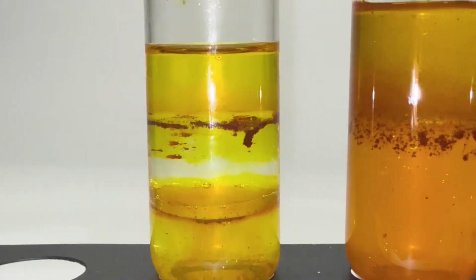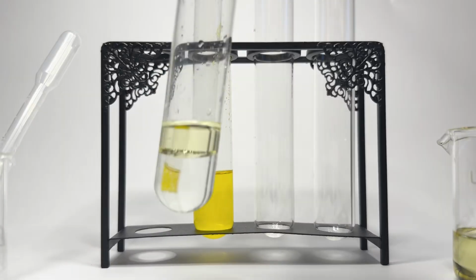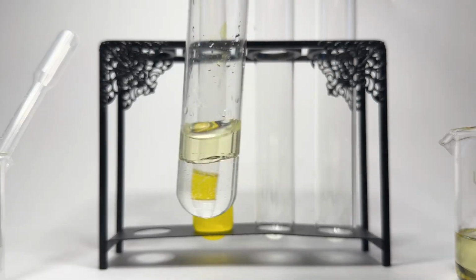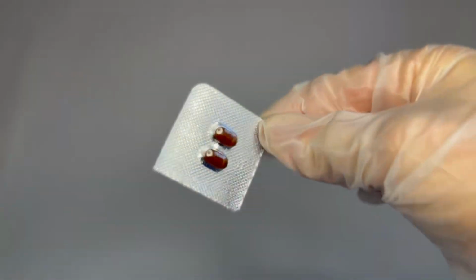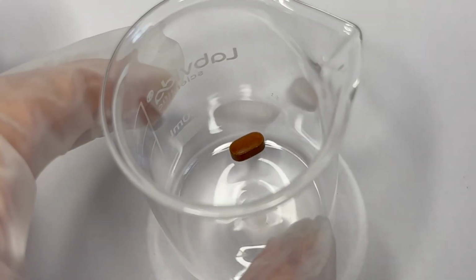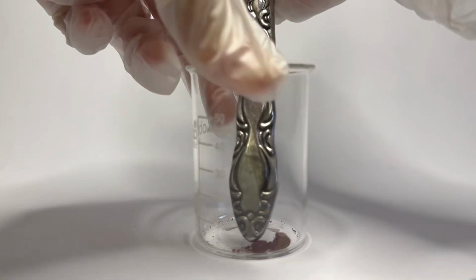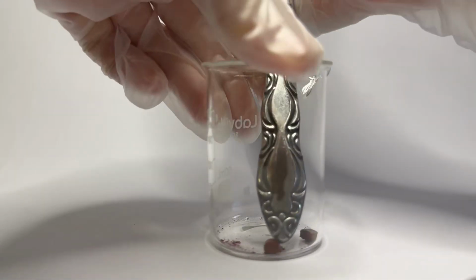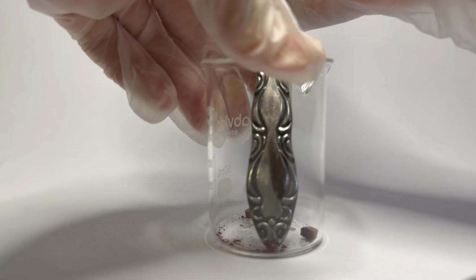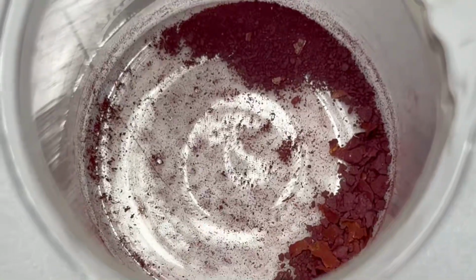Today, I'm going to be looking at aqueous and organic liquids and how layer separation has principles that relate to the body itself. This is phenazopyridine hydrochloride, which is a urinary tract analgesic, meaning it gets rid of pain from urinary tract infections. In the body, ionized molecules are easily transported in the general circulatory system, the aqueous blood, and excreted in aqueous urine. Unionized nonpolar molecules are better able to penetrate cellular membranes and reach sites of action.